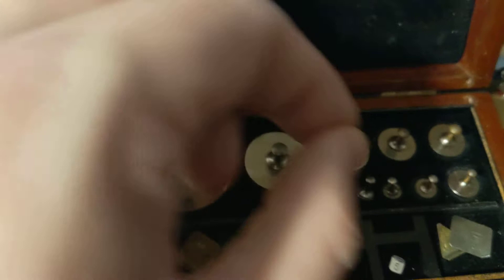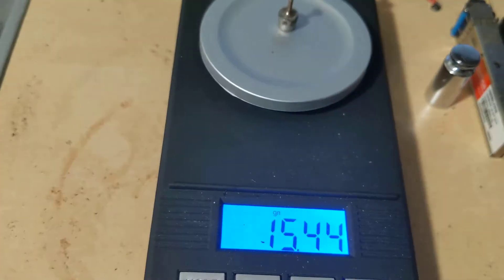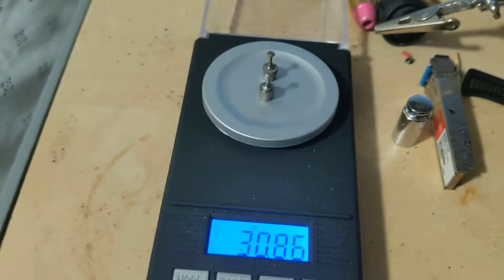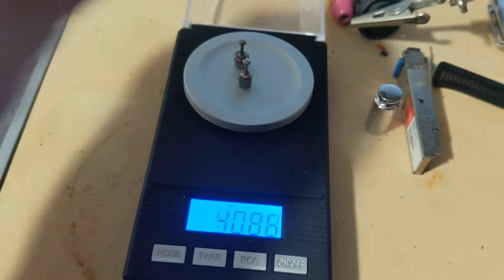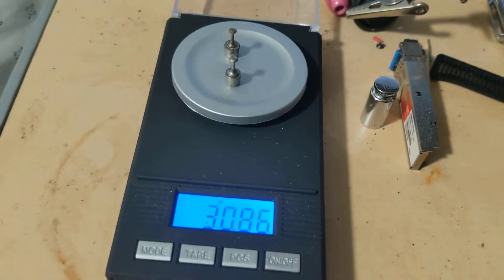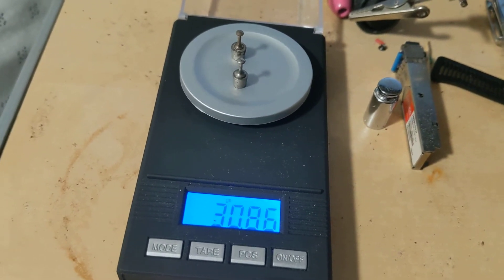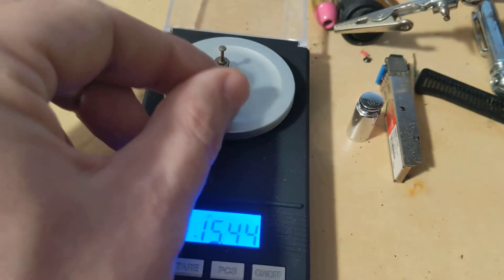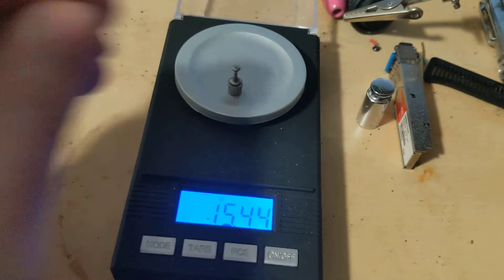Let's try a one gram weight. That should be 15.43 grains. Let's try a different one — 15.44. And again 15.44. You'll notice that doesn't add up, but we're talking hundredths of a grain here, and who cares, right? Consistently reading 15.44.